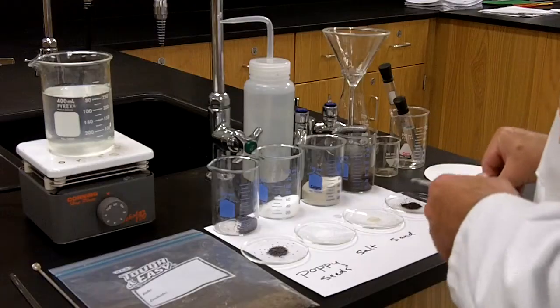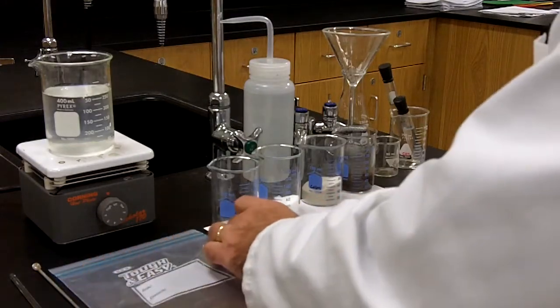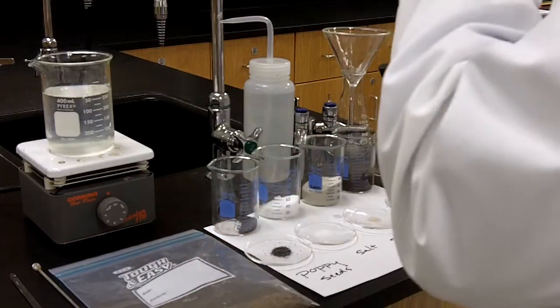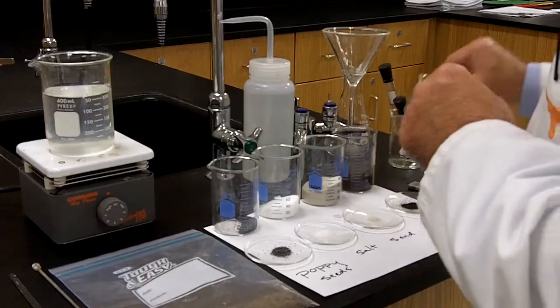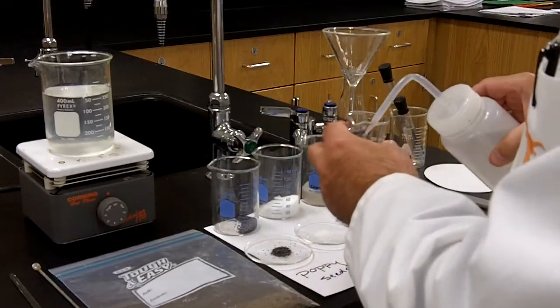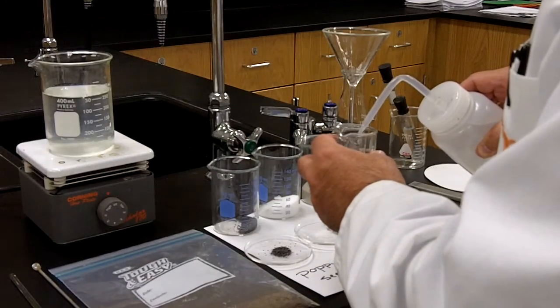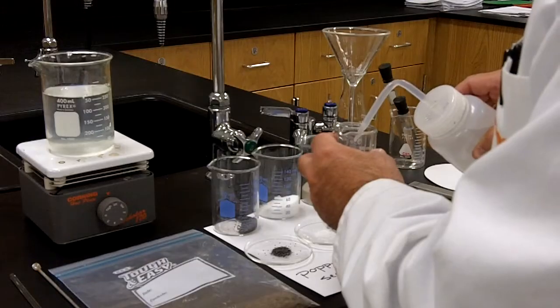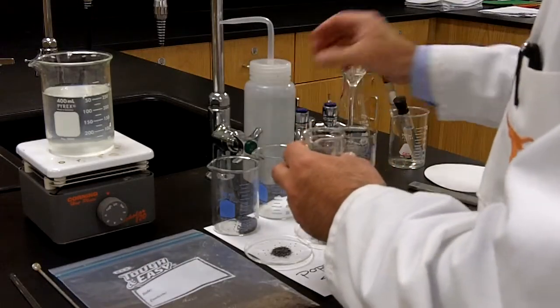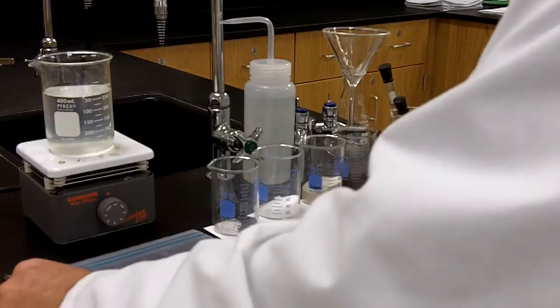Okay, so that's that. Let's take a look at the poppy seeds. The poppy seeds are very light. They're not very dense at all. In fact, I'm going to do a little experiment right now in which I place a little water, just a bit of water, into a beaker. Just like that. I want to determine whether poppy seeds will float or not. I believe they will, but let's see.